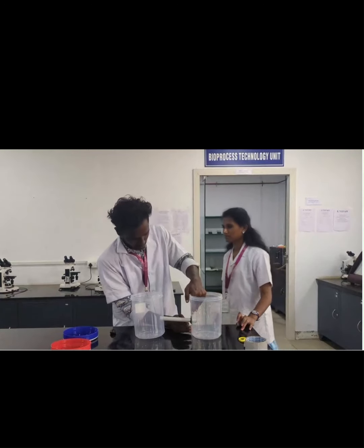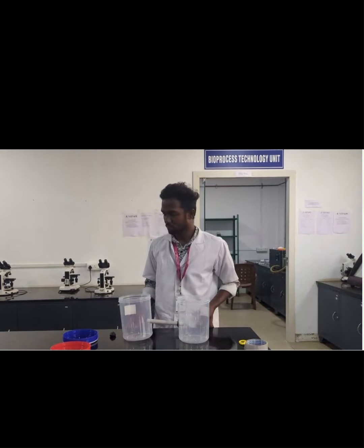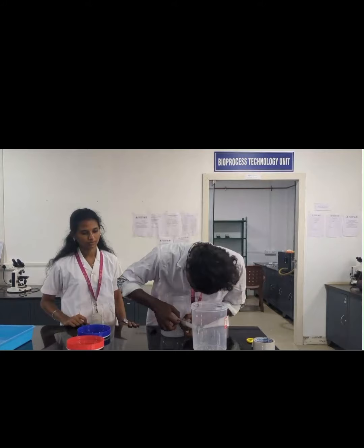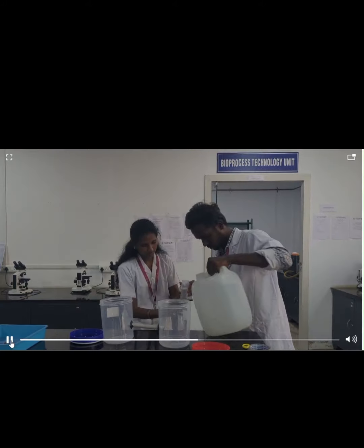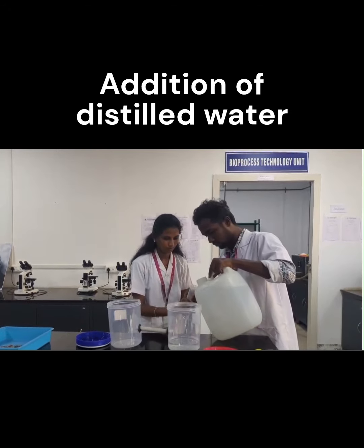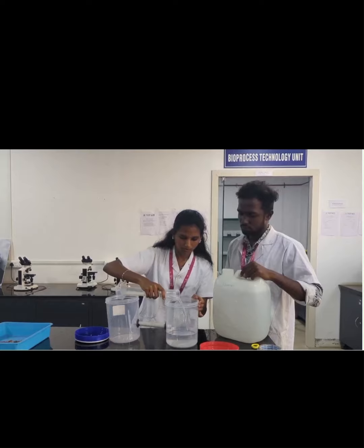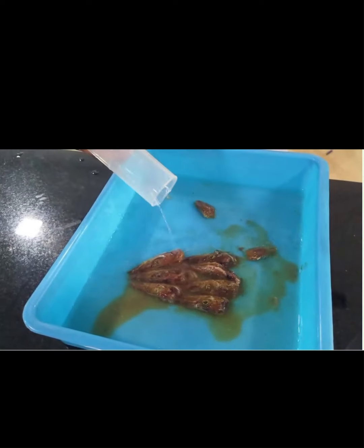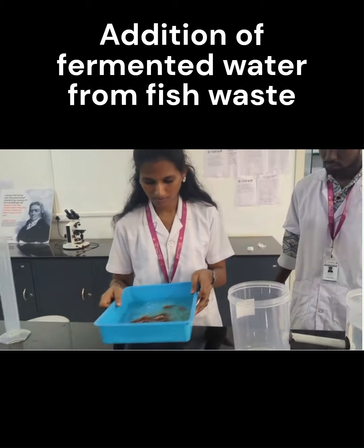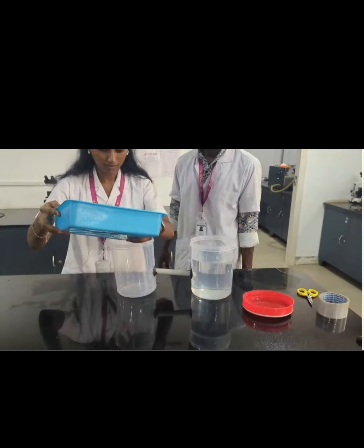One container contains distilled water, and another container contains fish head fermented water. We are seeing the demonstration of how the salt bridge is connected. The first container has distilled water, and the second container has distilled water along with the fermented fish waste water.